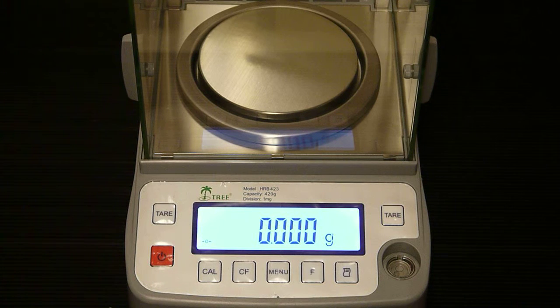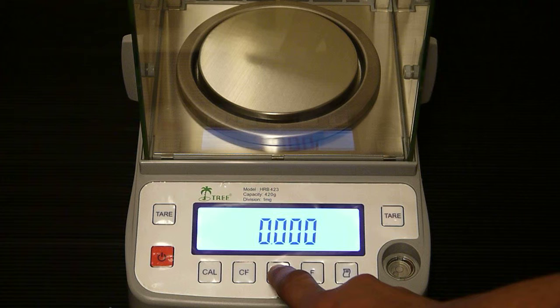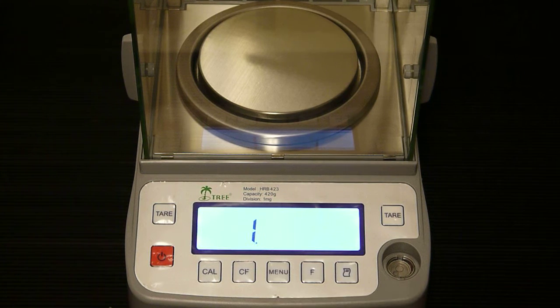To do so, hold down the menu key and a 1 will appear on the display. Now our code starts with 1, so we want to press the function key to move to the next digit.